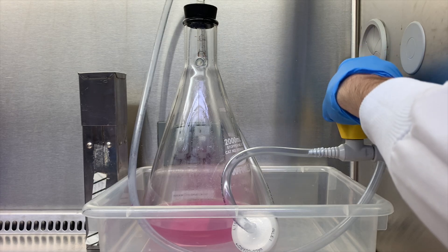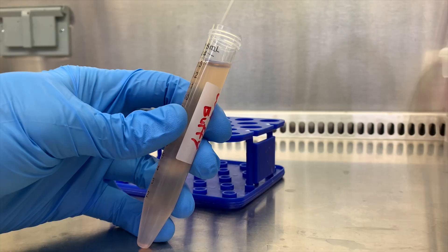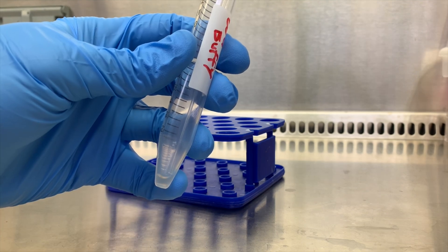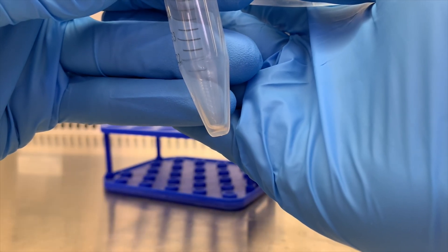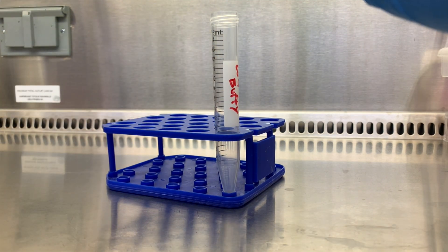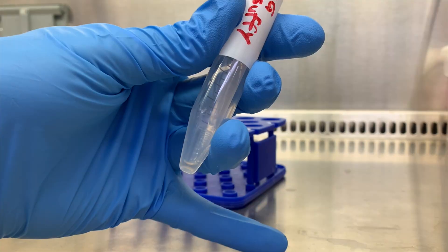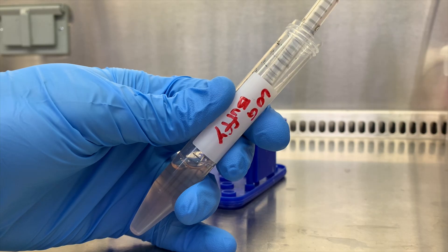Okay, our cells are pelleted — let's turn on our aspirator. We'll use these long glass tips. I like to get the bubbles out first and then just stay near the top until I've almost gotten all the supernatant out. Please be careful not to suck up your cells — we want to keep those. I think I got a little close for comfort here, but it's a Saturday morning and I had a long night, and there's a camera between my arms blocking the view.